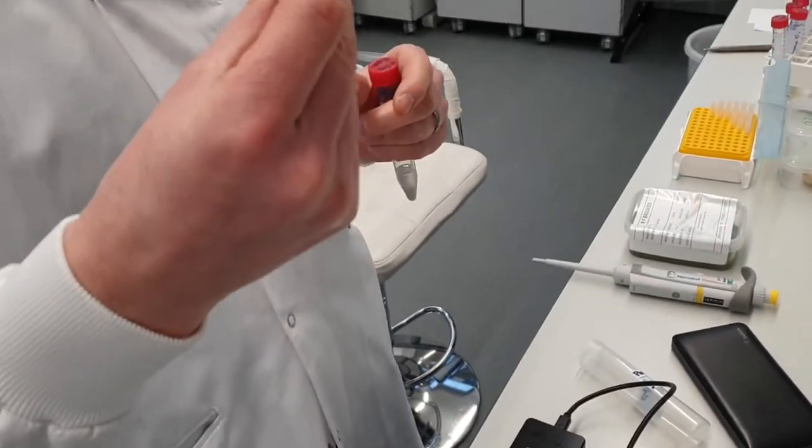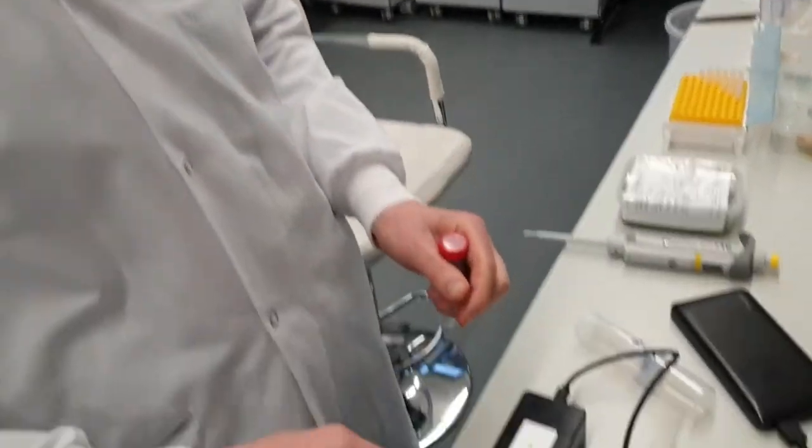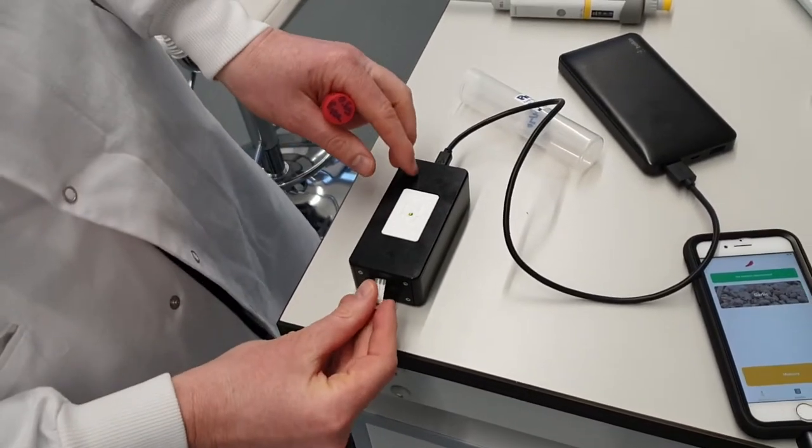The next thing I'm going to do, take the sensor, put it into the meter, which we're doing.